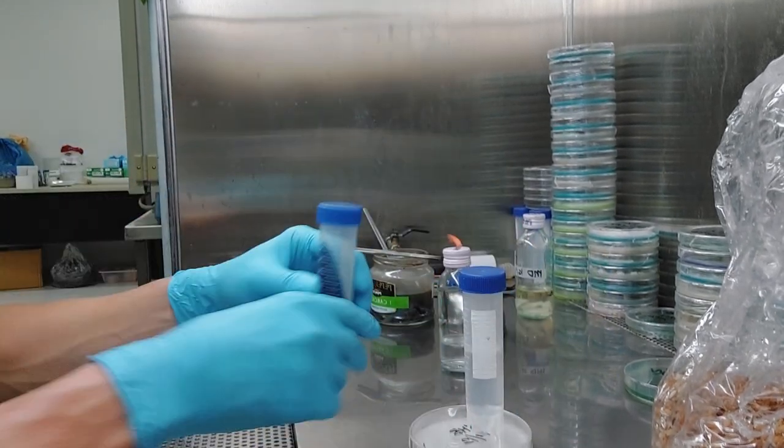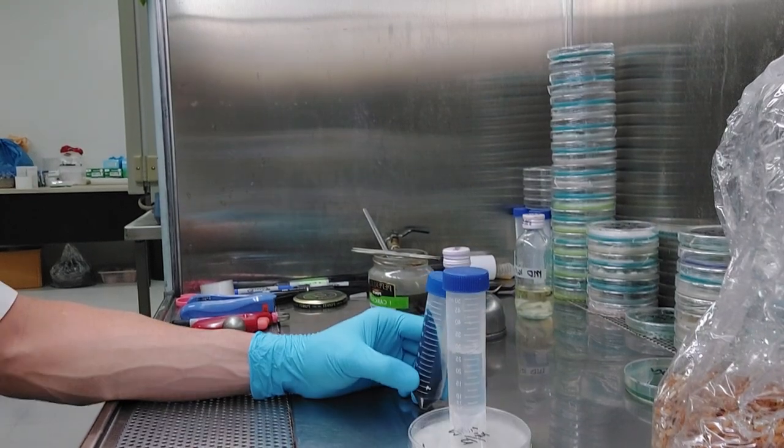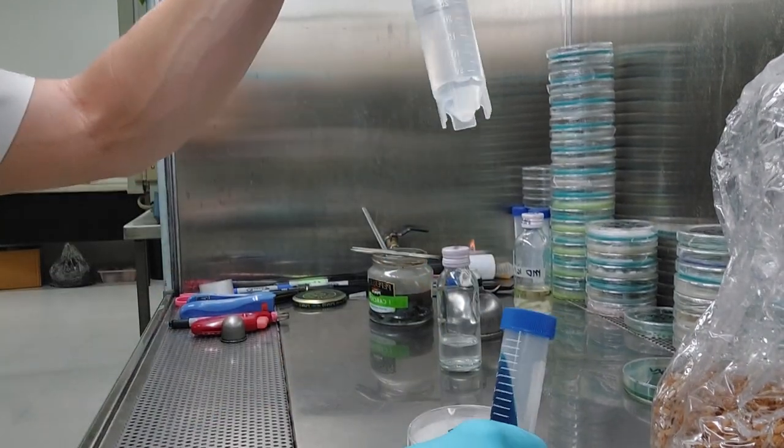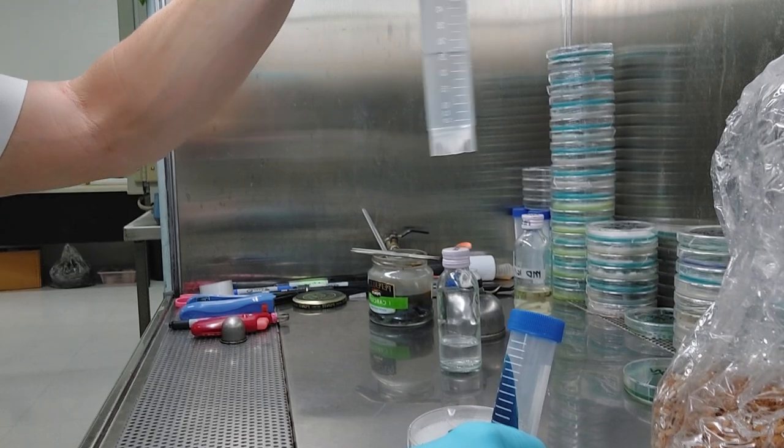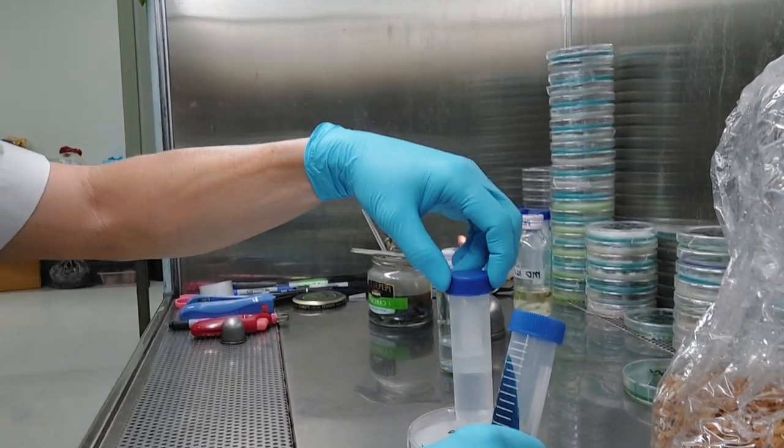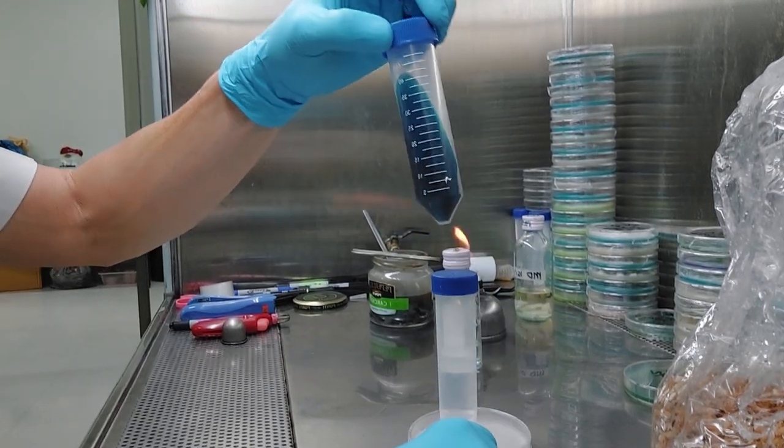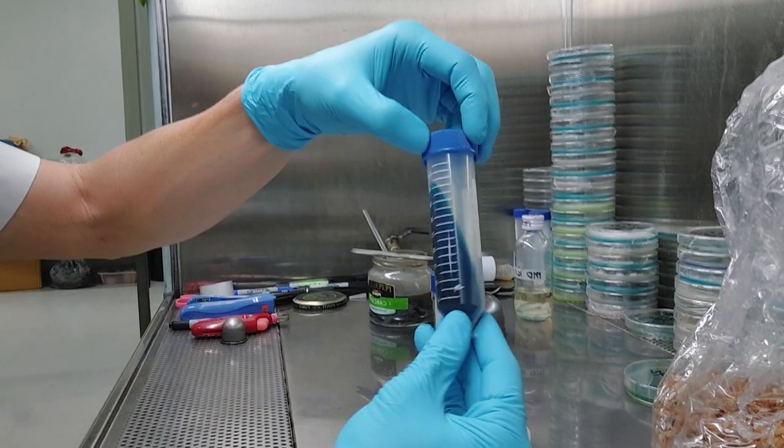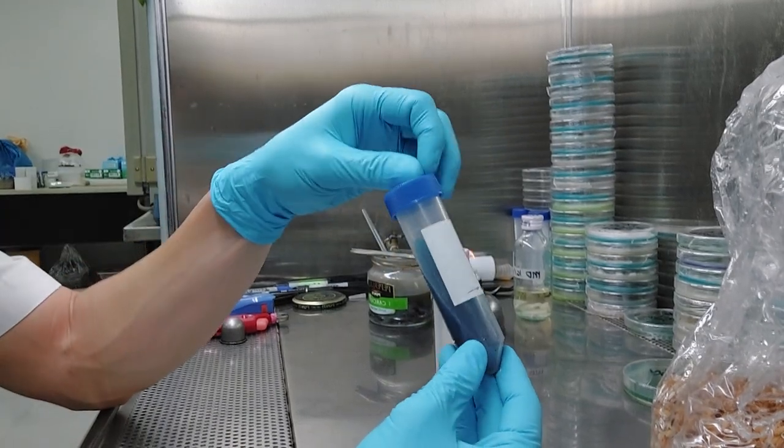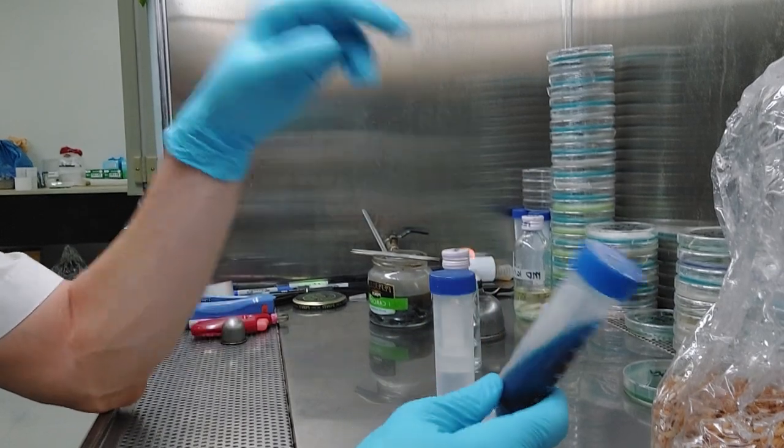This thing is meant to stand up, but if you are using this for something else, it might be problematic. Also, this probably wouldn't fit in a standard centrifuge. I think they call them carousels. The little holder thing, the little basket that they use to spin these around. They're designed for these. These have been around for probably 30, 35 years in this design. They're what we used to call falcon tubes. Now they have different manufacturers, but whatever. They're 50 mLs.